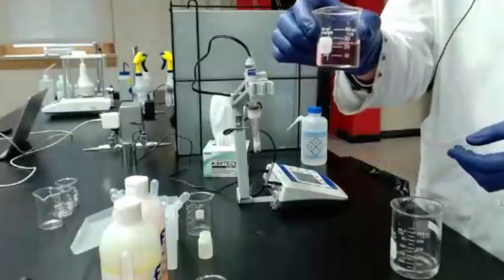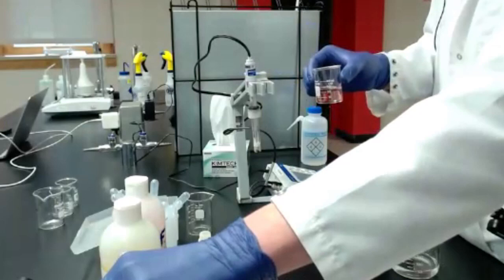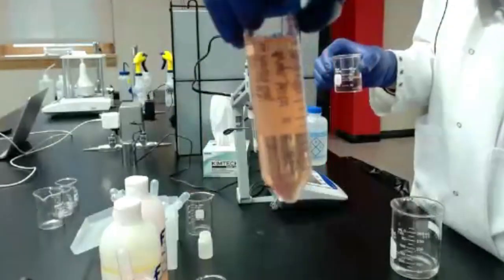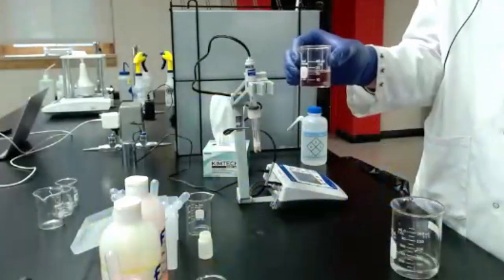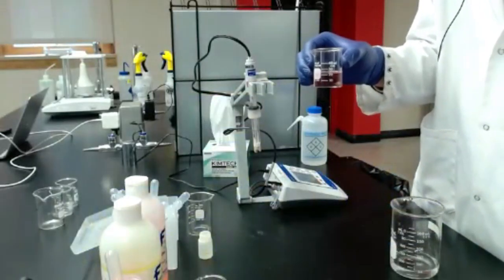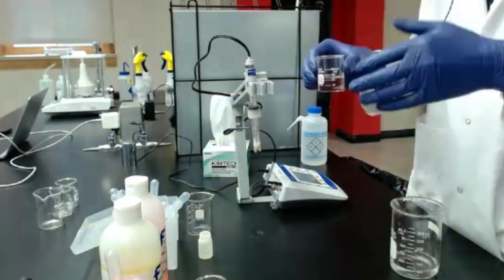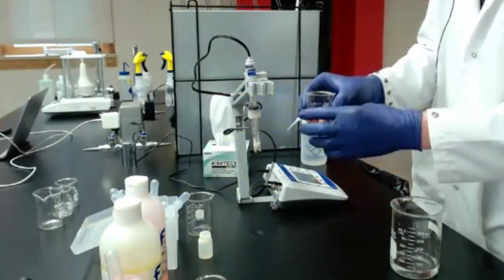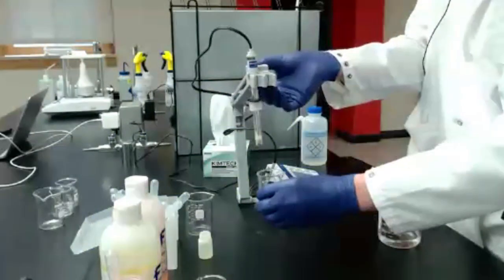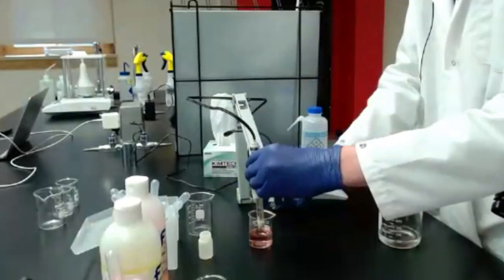I have a little bit of buffer in a small beaker. If you have those tubes like I showed earlier, those work well. Just making sure that you know when you poured out that buffer and how old it is, because they will go bad, they will drift and come off of the value that they're supposed to be. So I've got my buffer here, and I can just lower my pH probe right in there.